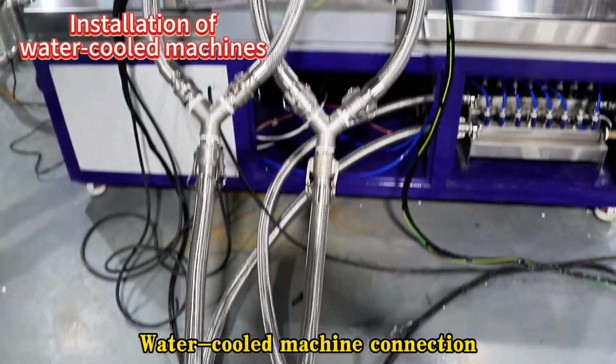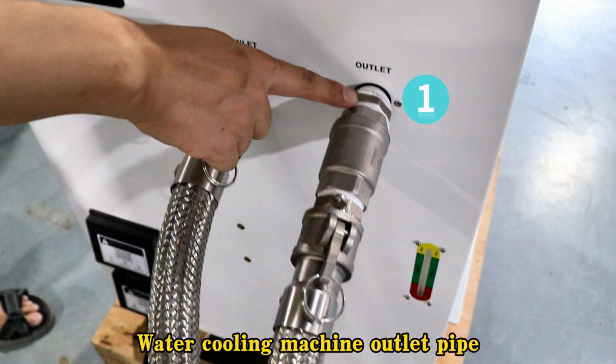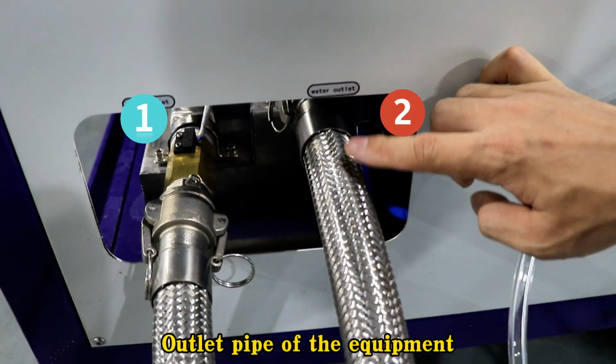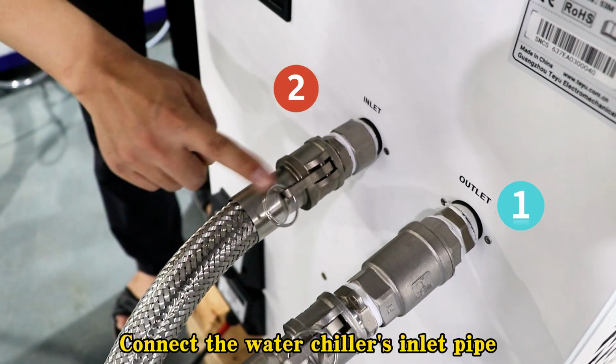Water-cooled machine connection. Water cooling machine outlet pipe. Link the water inlet of the device. Outlet pipe of the equipment. Connect the water chiller's inlet pipe.